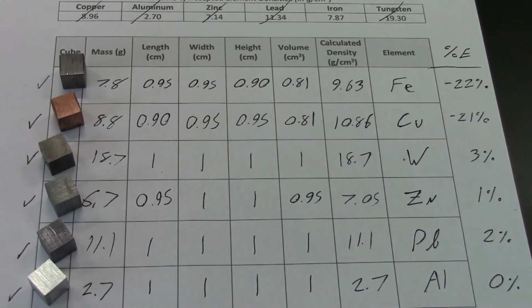A lot of times the tungsten that you buy is also tungsten carbide, which is an alloy with carbon as well, and that's much more common than pure tungsten because it's so much harder. But the fact that our value was extremely close to the pure value suggests that this is indeed pure tungsten. It's very interesting to me that the copper is off by so much, because that should be a fairly pure metal. There's not a whole ton of copper alloys besides brass and bronze and things, but those would be very visually different. So this looks like pure copper, but it's off by a decent amount. So I'm not exactly sure what the deal is there. It may be predominantly a volume error, but that's interesting.